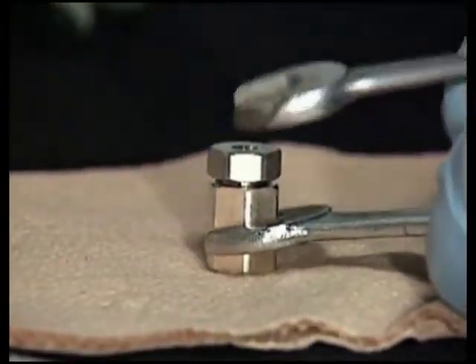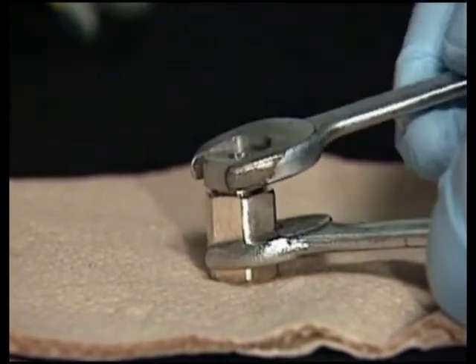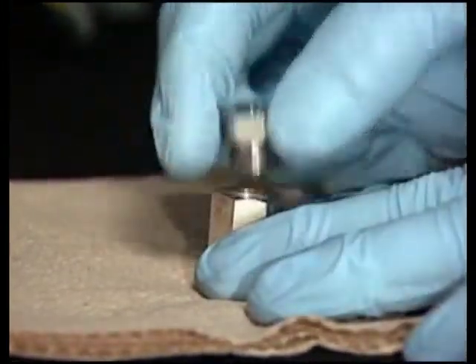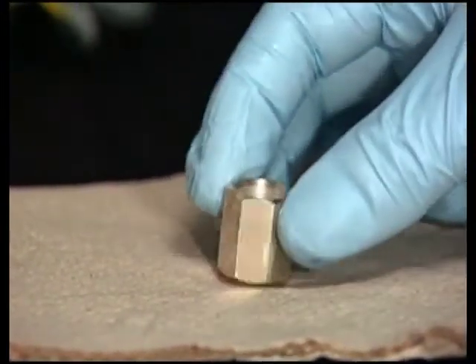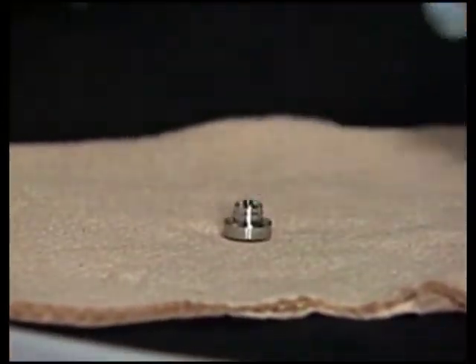Use two 5/8-inch wrenches to separate the inlet and outlet housings. Then remove the filter from inside the housing.